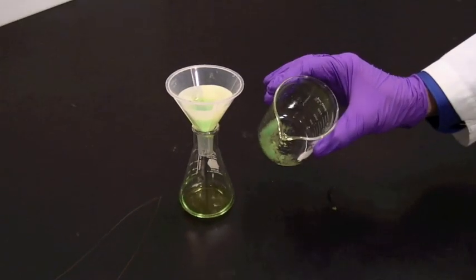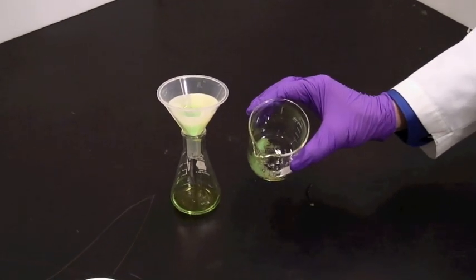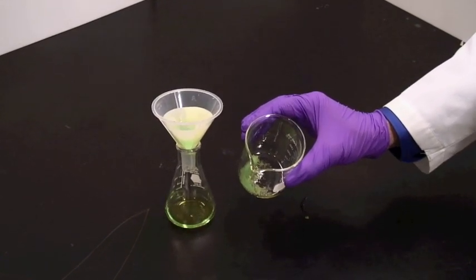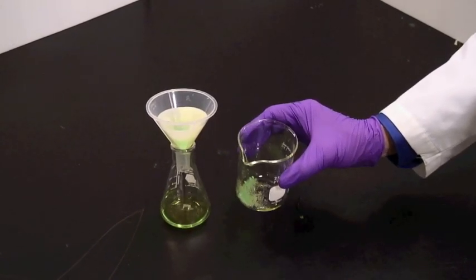It may be that you need to take a break and pour some more if you have too much capacity. Now, you may notice I didn't get all of the solid in the first time, and so what I need to do is do a second round on this and transfer it with liquid.